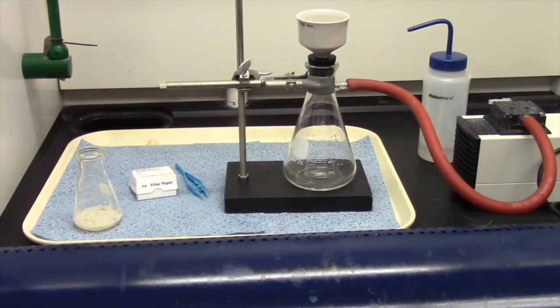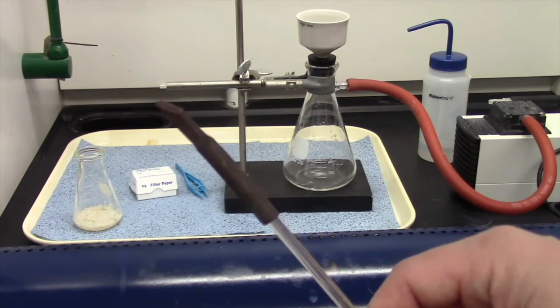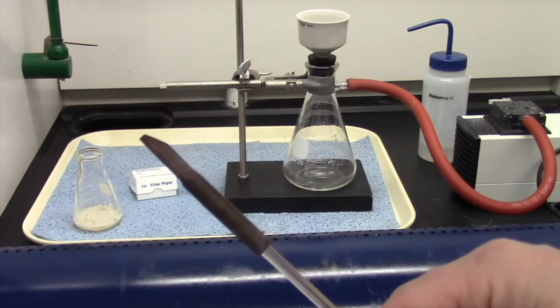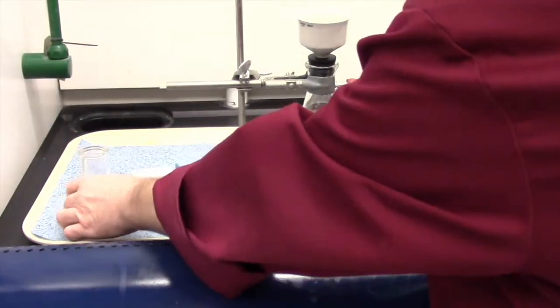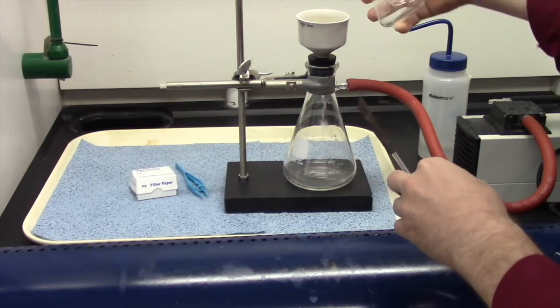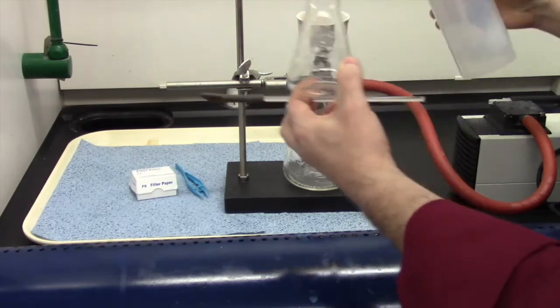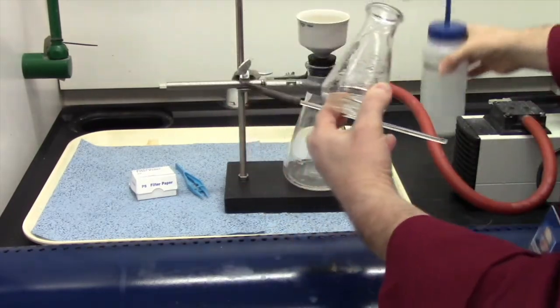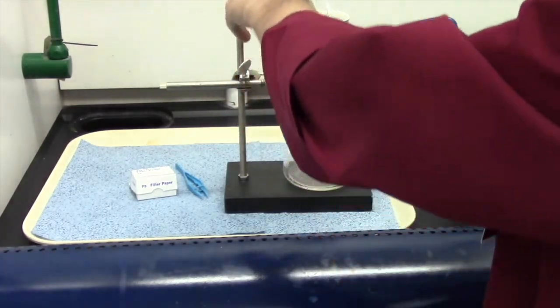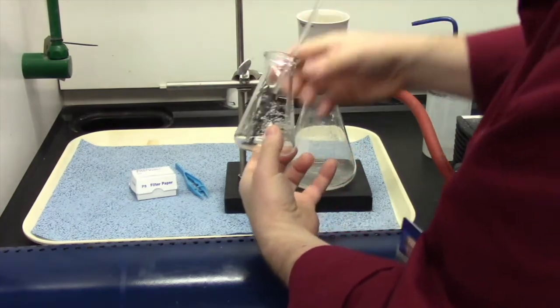Now we are pulling through the funnel, pulling air down through the funnel. I'm going to pour on my sample. I got myself what's called a rubber policeman. It's used to scrape out the soap particles into the funnel. So I'm going to do that right now. There you go. I may not even need it. I want to rinse with a little bit of water. I'm going to use my rubber policeman to get in there and scrape off the sides a little bit, pour it into there, set that to the side.